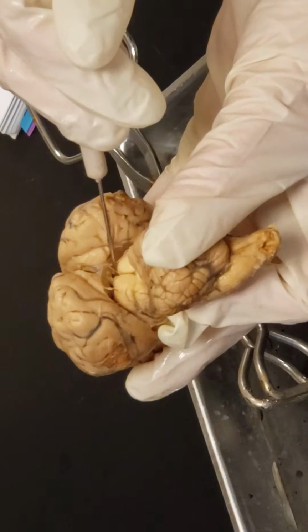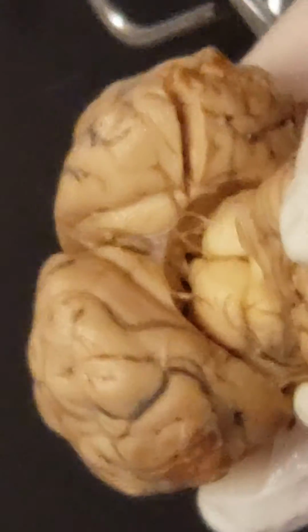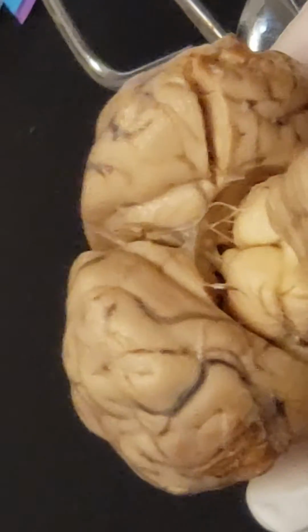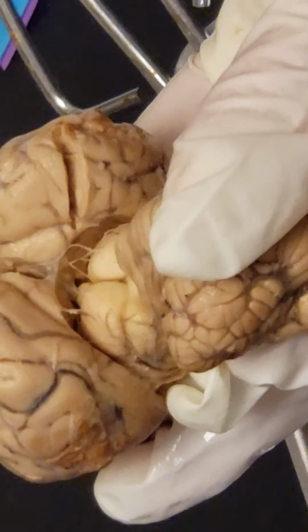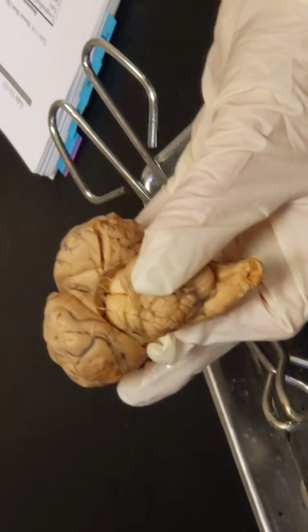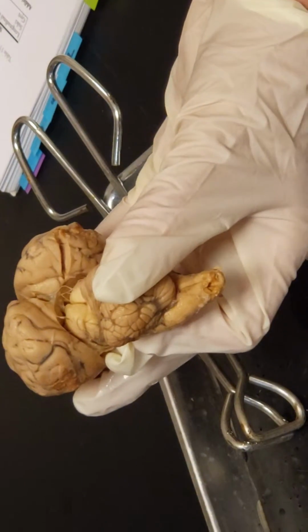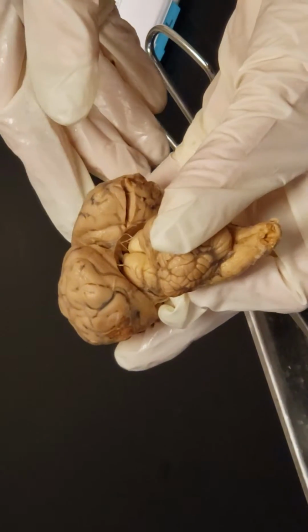And if you look right above that, you'll see the pineal gland, which is responsible for secreting melatonin, which helps you sleep at night. It tends to be secreted in darkness, and we think this is why we're diurnal, that is the hormonal pattern that we follow. So, great. So there we go with column 1.